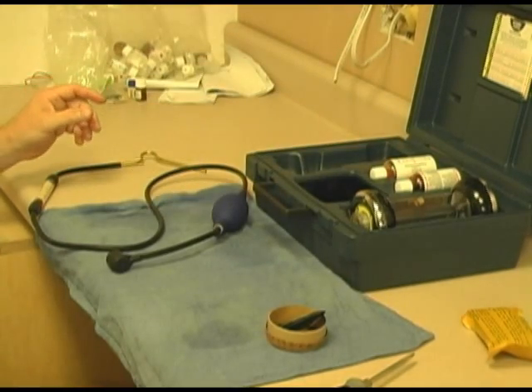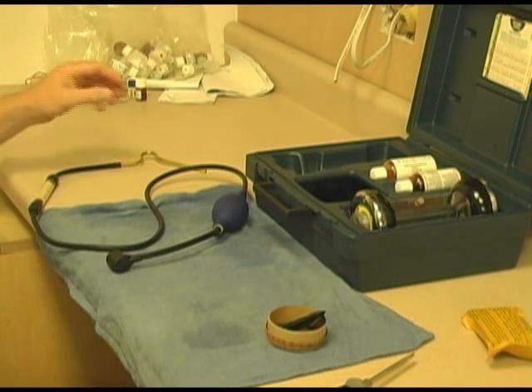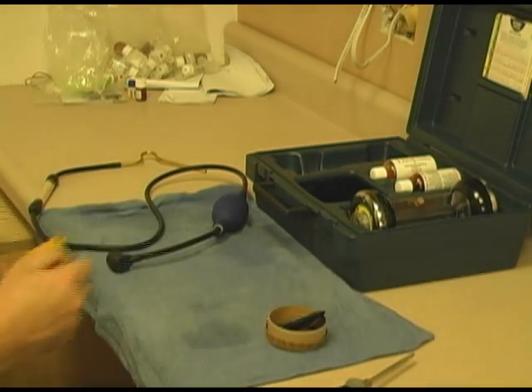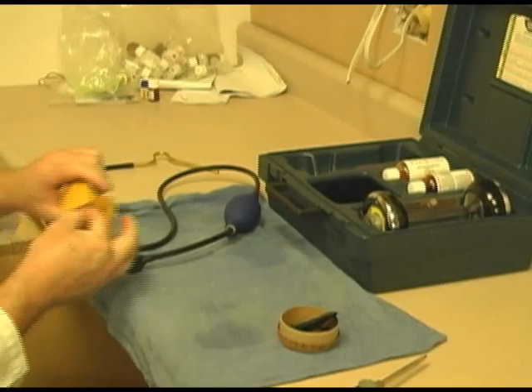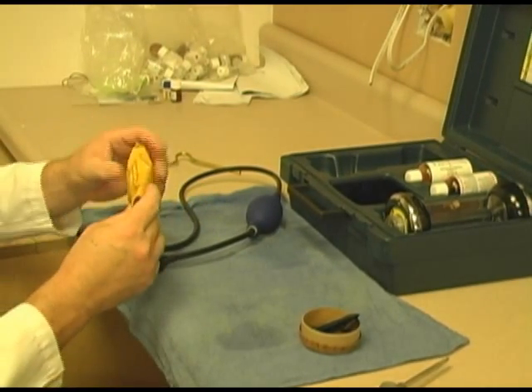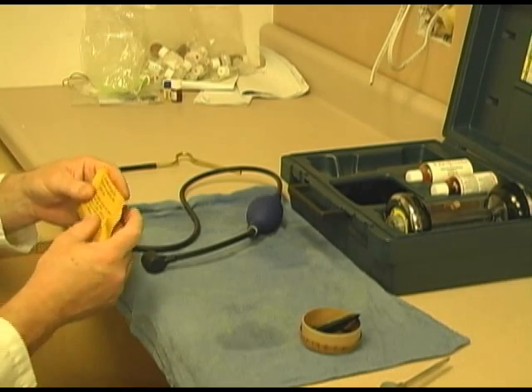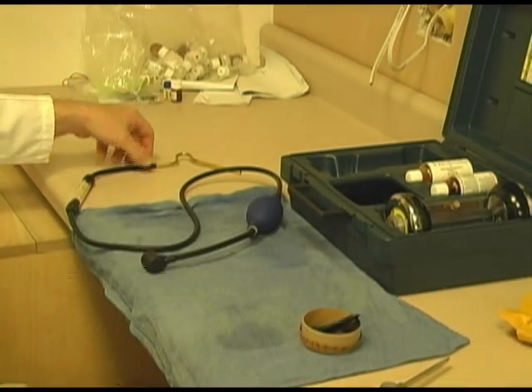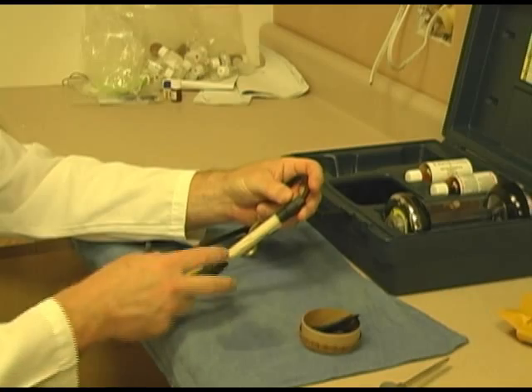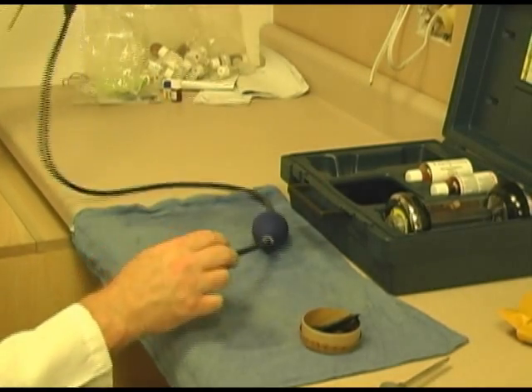We are going to do some preventive maintenance on this particular unit, or if you prefer, rebuild it. It's all a matter of terminology. First of all, let's go and see what's in the PM kit. First thing we're going to look at is the string, or moisture absorber, or whatever other technical name you want to put to it. A Fyrite filter. That goes right in here, and when you're running the unit, when you're taking a measurement, you should have that damp. I'm not saying wet, but damp. It affects the CO2 rating.